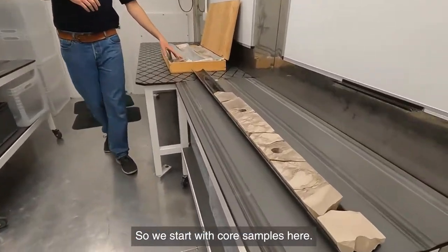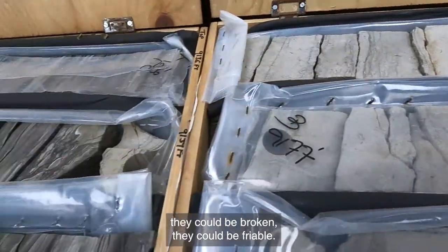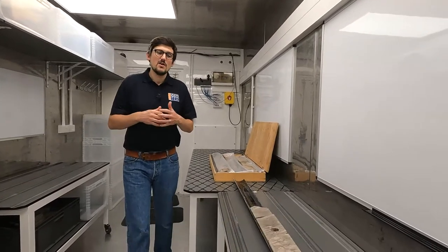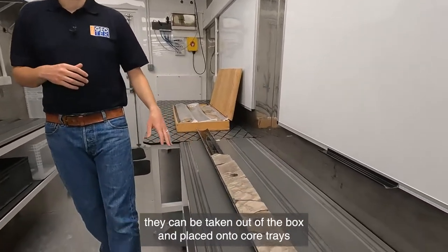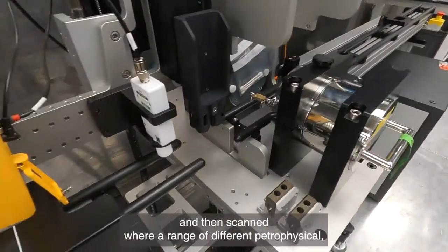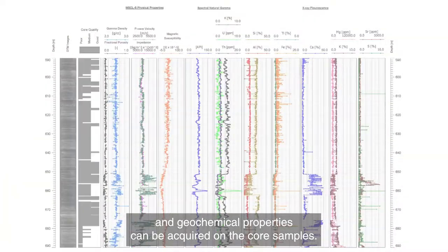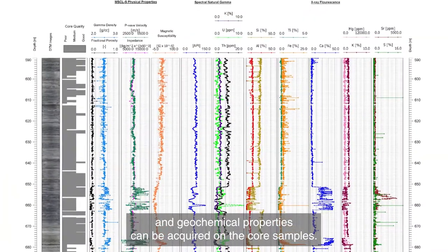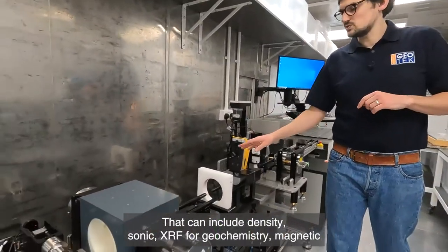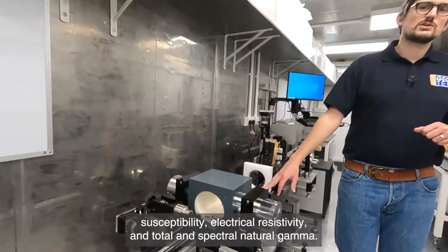We start with core samples here. The core samples can come in boxes — they could be whole, split, broken, or friable. All of them are valuable and all of them need information extracted. For those that are competent core samples, they can be taken out of the box and placed onto core trays and then scanned on the MSCLS, where a range of different petrophysical and geochemical properties can be acquired. That can include density, sonic, XRF for geochemistry, magnetic susceptibility, electrical resistivity, and total and spectral natural gamma.